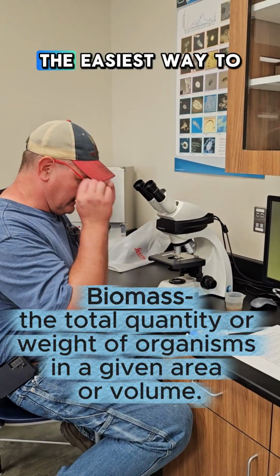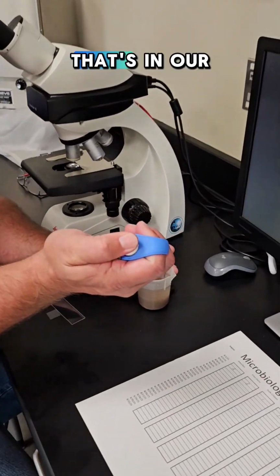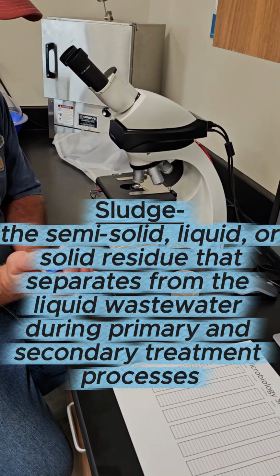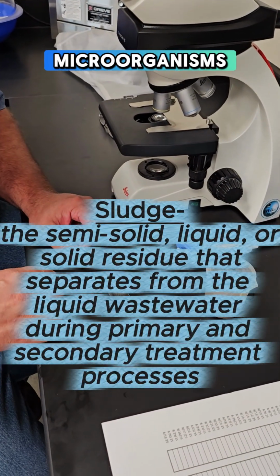The easiest way to do that is just to take a sample here. This is our settled sludge that's in our activated sludge basins. I'll just kind of continue. So we're going to prepare a slide of our activated sludge and look at these microorganisms.